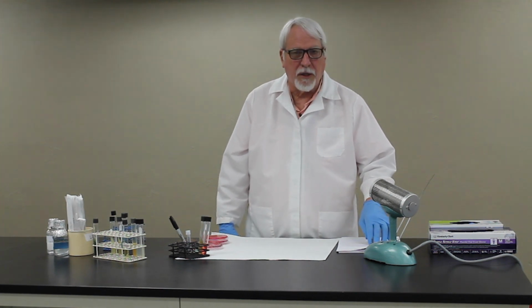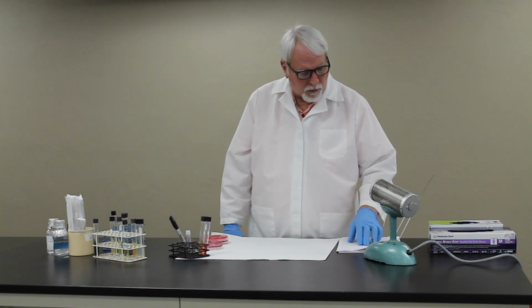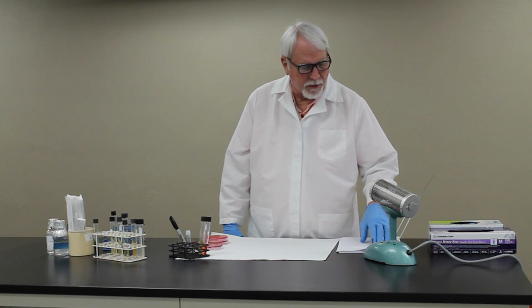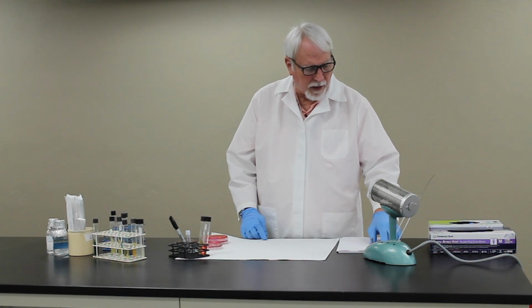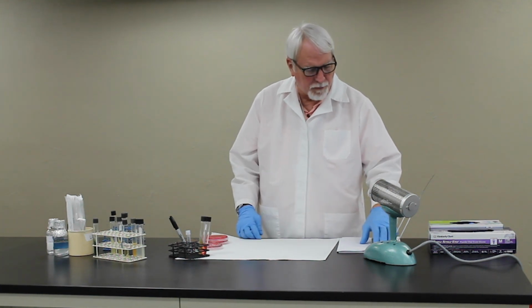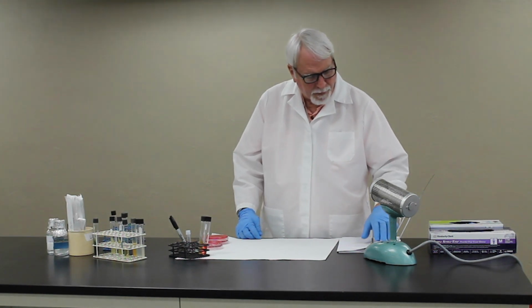After streaking your blood agar plate, we'll look at the colonies, and also you want to take a look at the cell morphology, because the staphs are quite a bit different in their appearance morphologically in the gram stain than the streps. The streps tend to be very tiny and in chains. The staphs will be larger and in grape-like clusters.